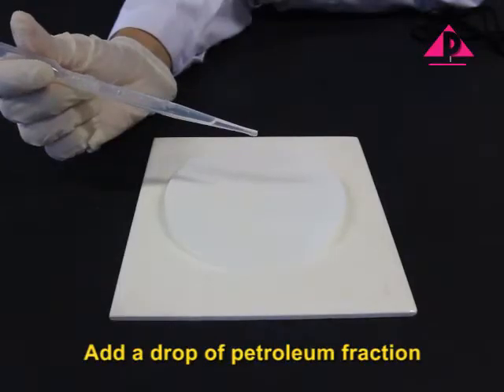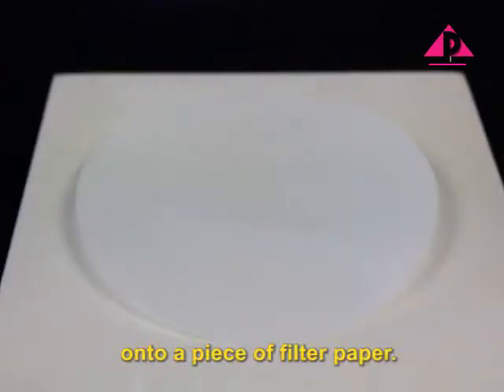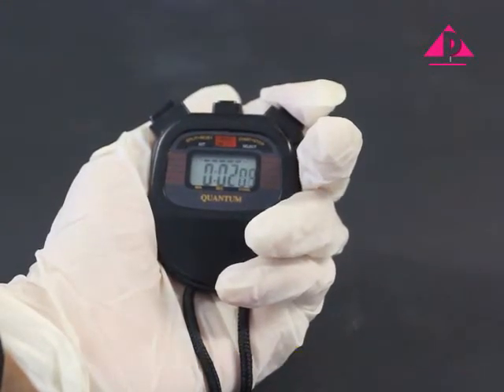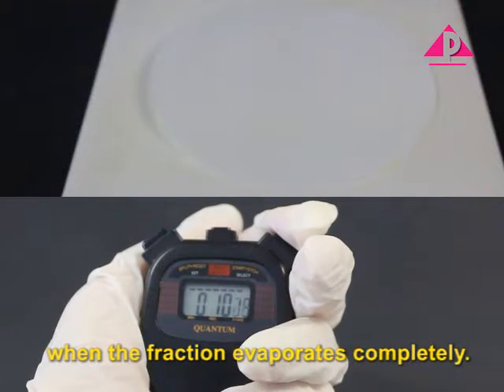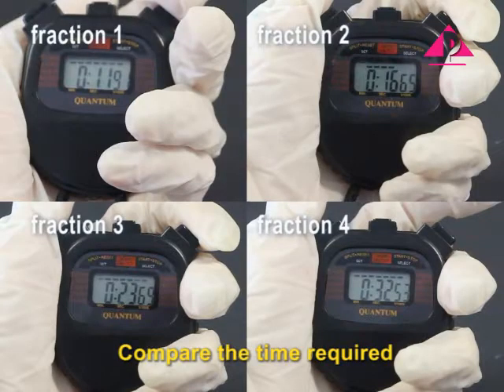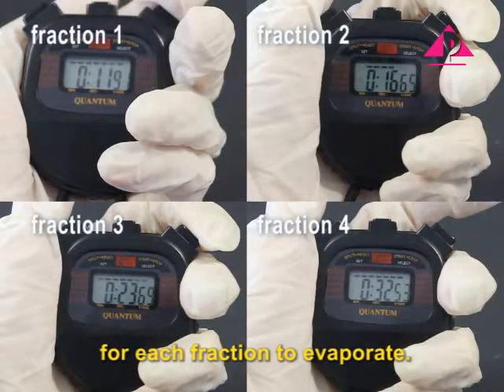Add a drop of petroleum fraction onto a piece of filter paper. Start the stopwatch immediately. Stop the stopwatch when the fraction evaporates completely. Compare the time required for each fraction to evaporate.